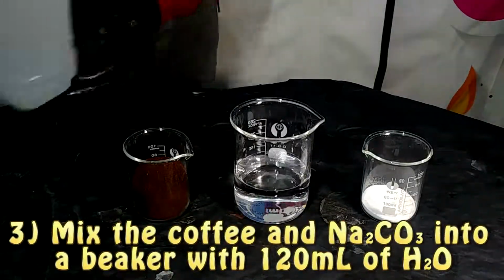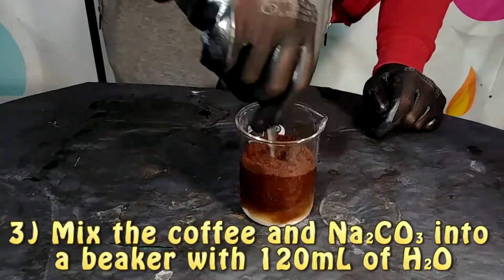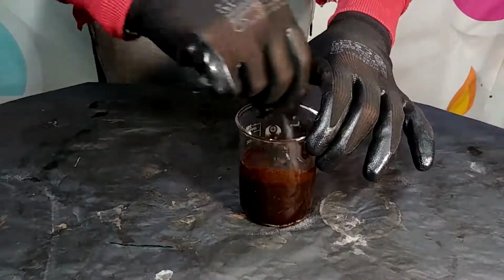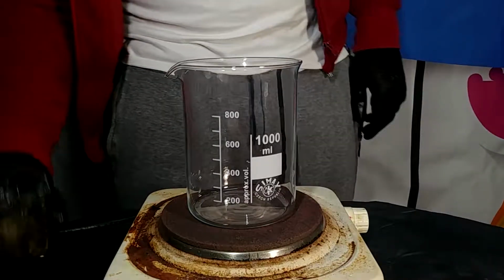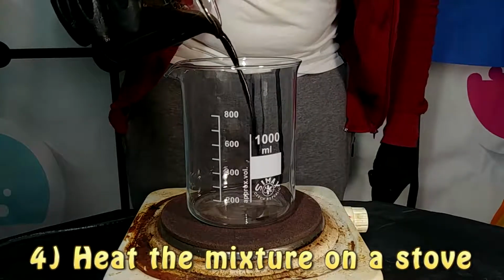After that, we are going to pour in a beaker 120 milliliters of water, and to them we are going to add the mixture of coffee and sodium carbonate. Then we are going to put this beaker on top of a stove and heat it up until it starts boiling.